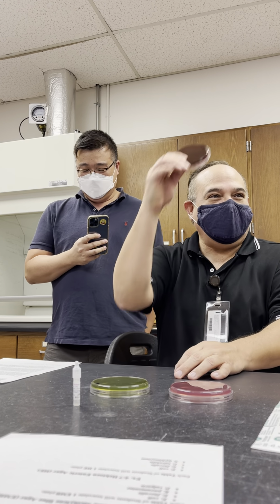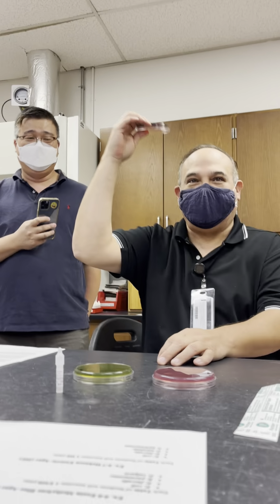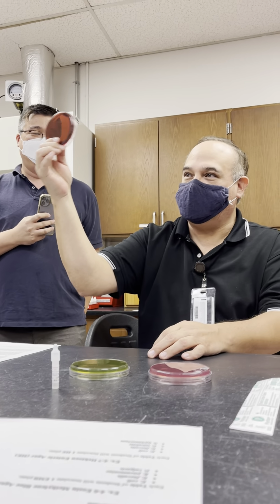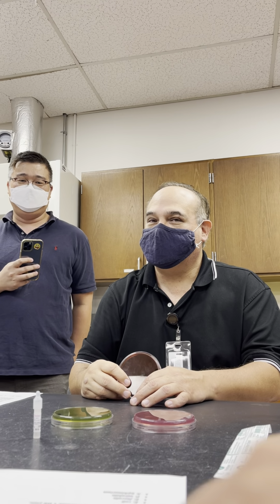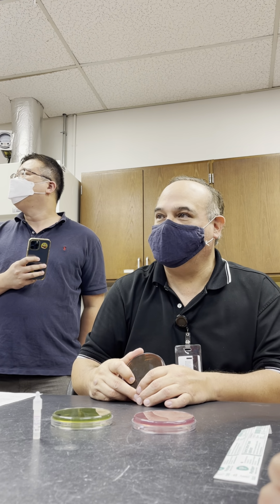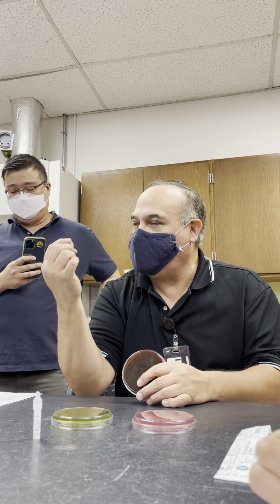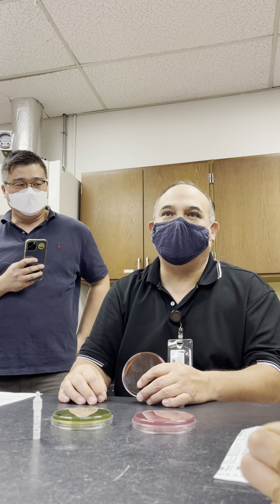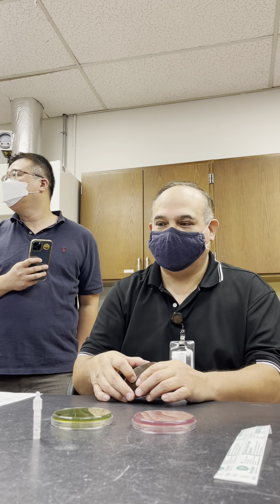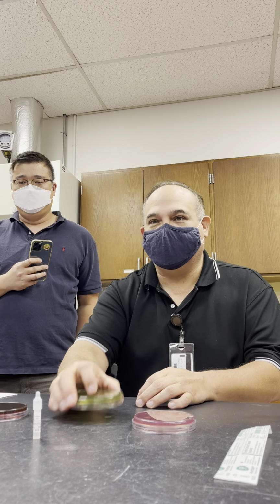Okay, so everybody with me? Everybody understands? So if I ask you on the practical, what is the application of EMB? You're going to say: to test for water, looking for fecal contamination. And the number 1 organism that is the marker for fecal contamination is E. coli. Okay? Good? All right. Let's go to the next one.